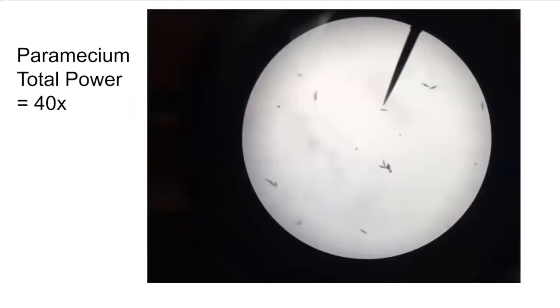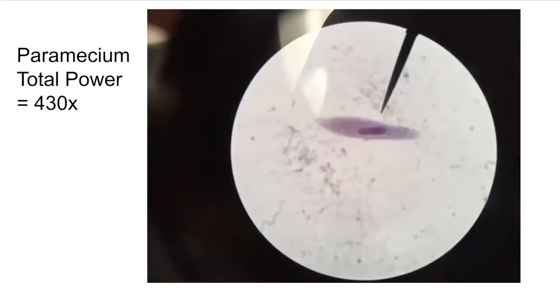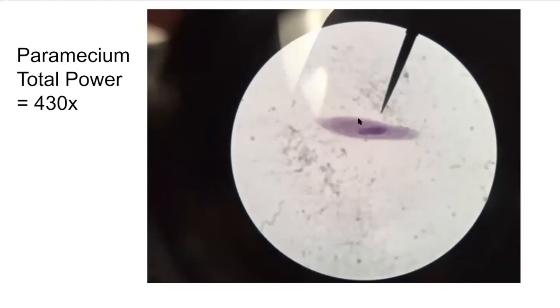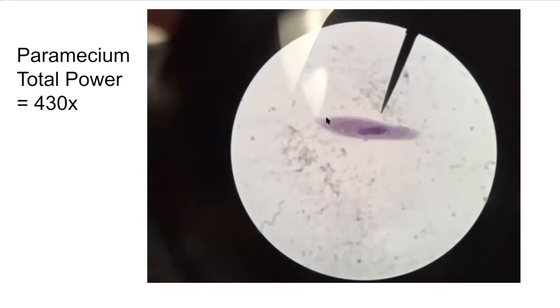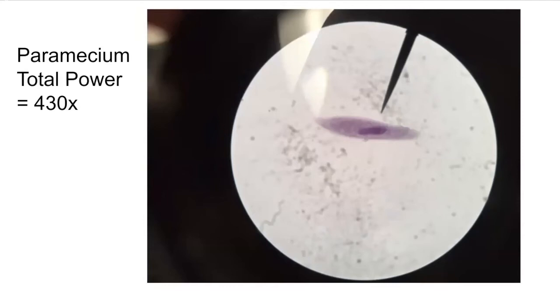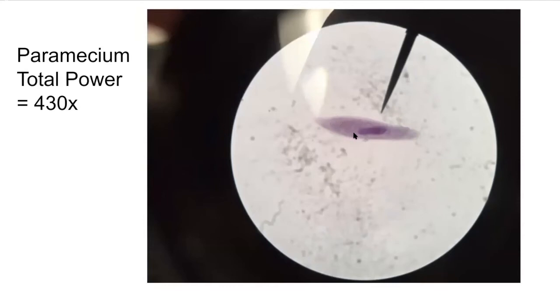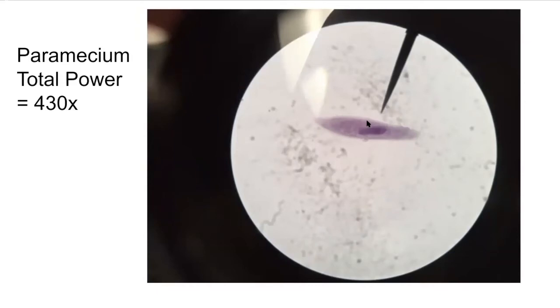These are paramecium on low power. As we increase magnification, they get bigger. On high power, you can see the nucleus in the cell and a fuzzy outline of the paramecium — that indicates the cilia present on the outside. These cilia are tiny little hairs that allow the paramecium to swim through its environment, and they can also sweep food into the gullet of the paramecium, which is kind of like its mouth.